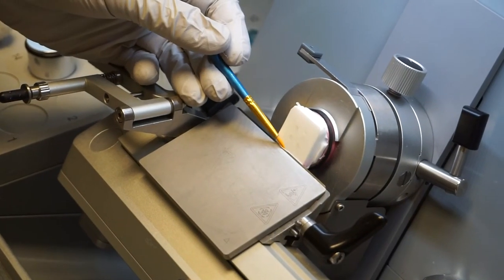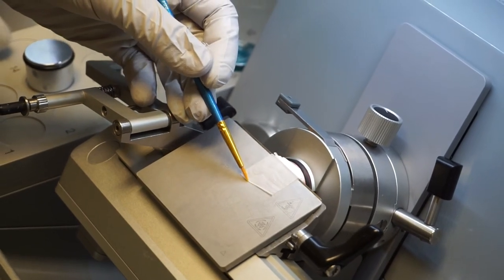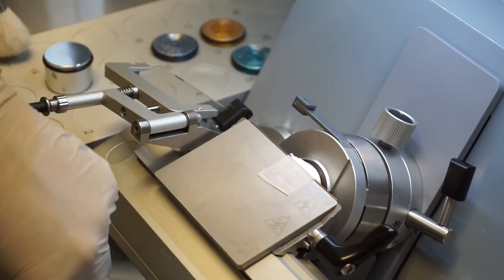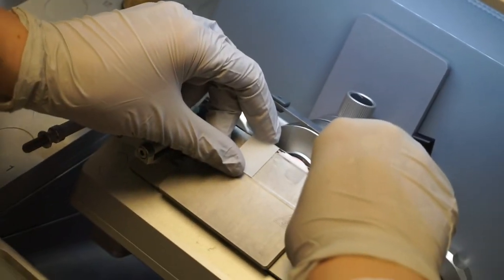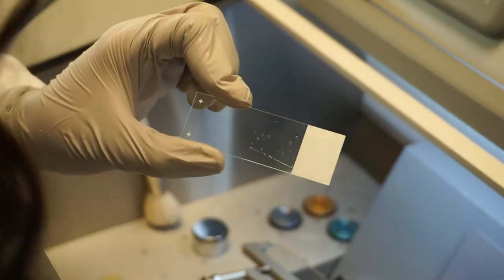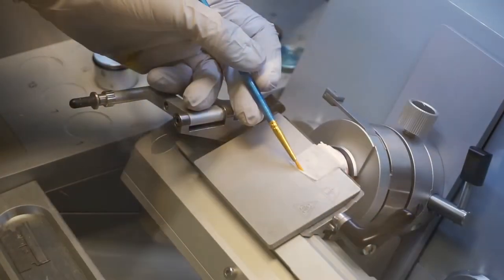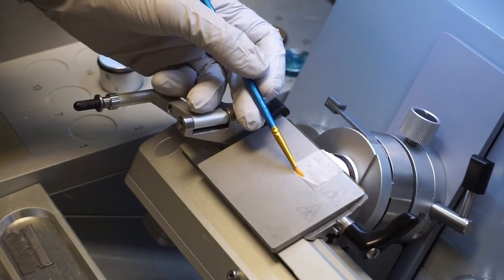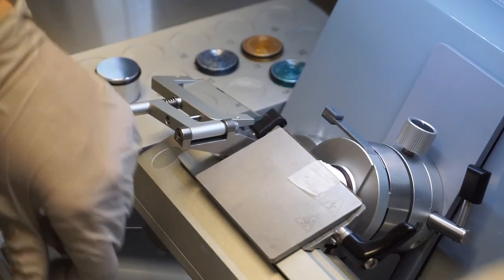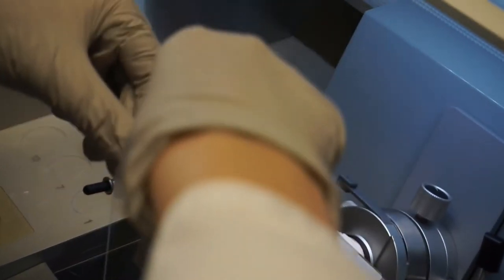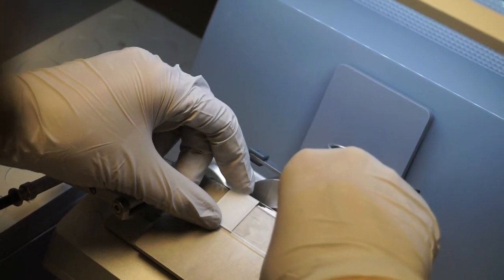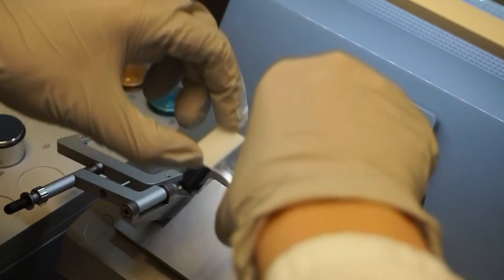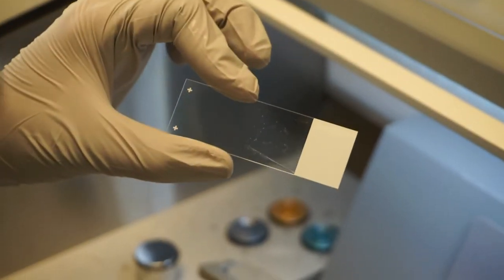Cut sections while preventing their rolling. Use a slide kept at room temperature to pick up sections using the thaw mounting method. Repeat this step until enough slides have been produced. Let sections air dry at room temperature between 30 minutes to 2 hours. Use the slides for the desired purpose or store them at negative 20 degrees Celsius.